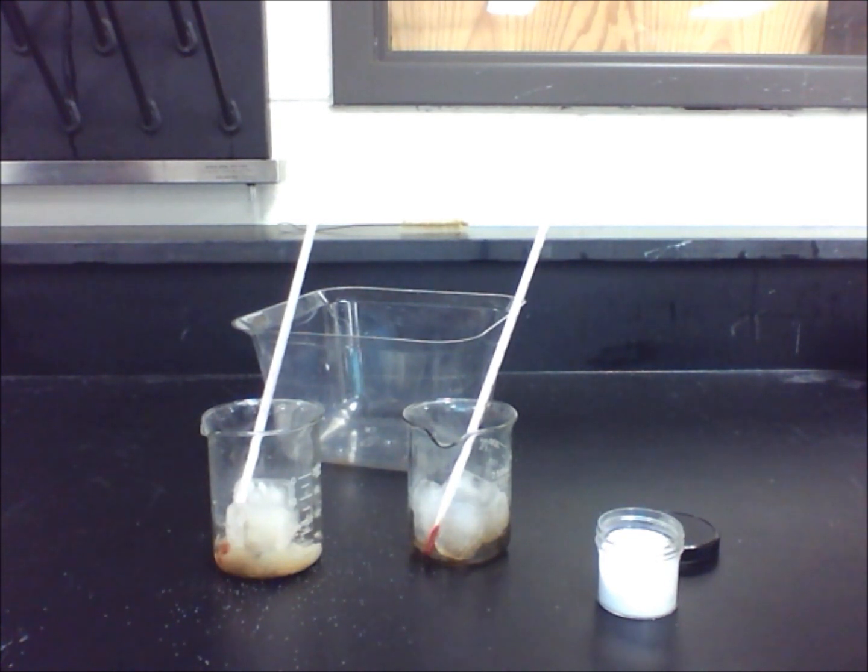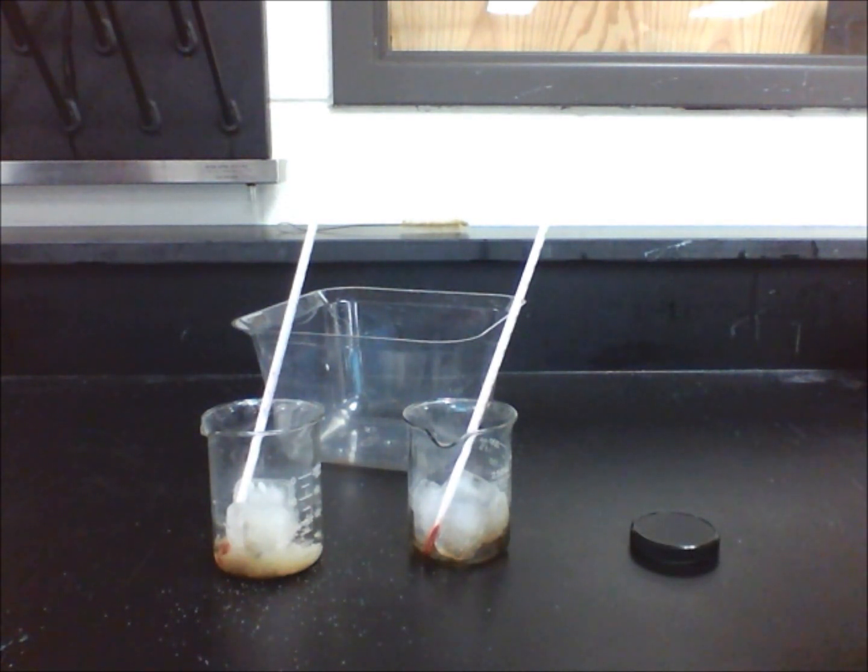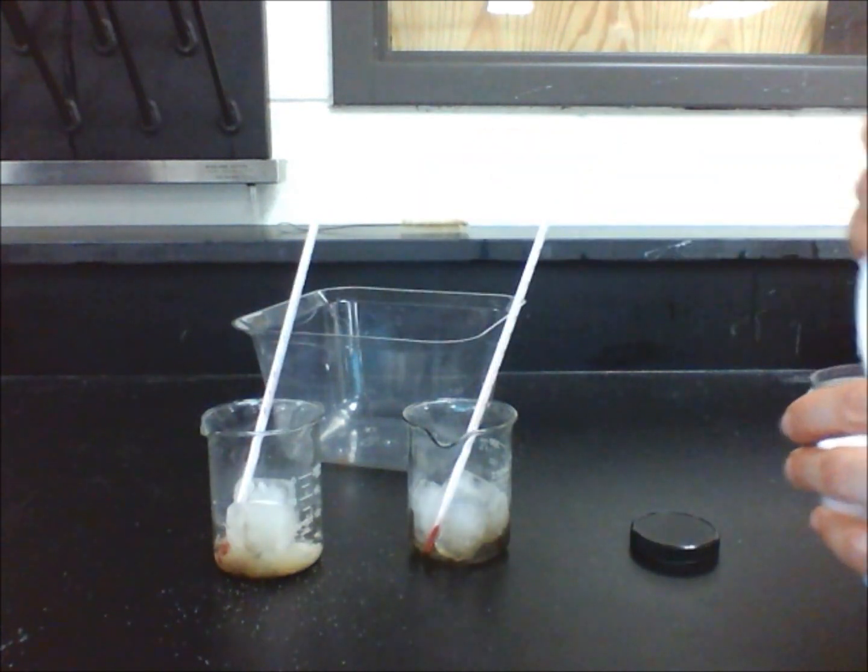What do you think will happen when two more spoonfuls of salt are added to the ice in beaker A only? Make your predictions again before proceeding on with the experiment.